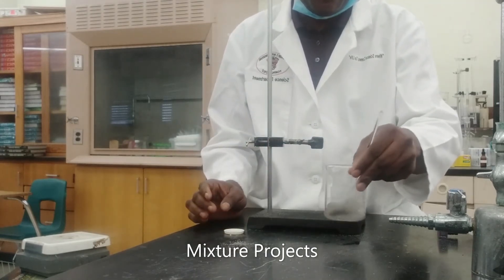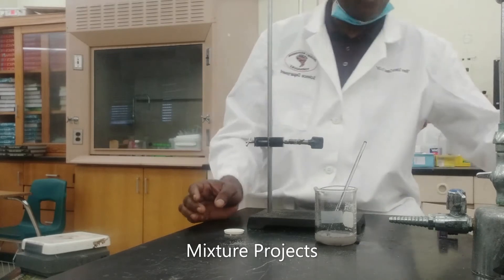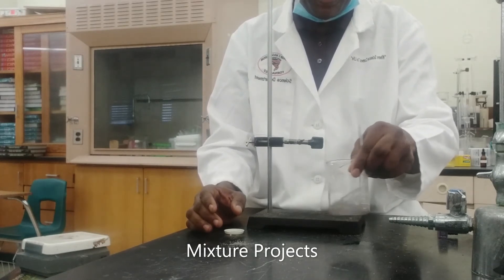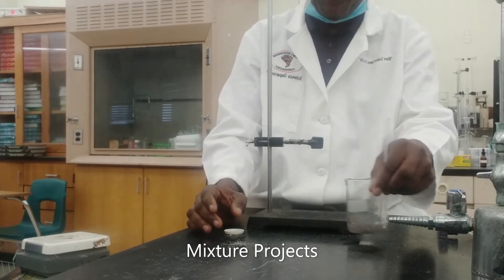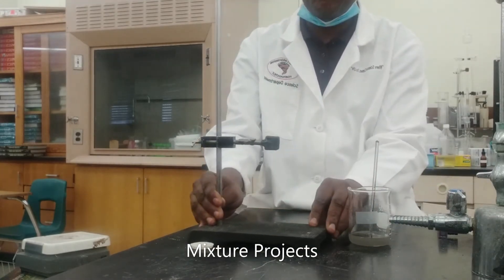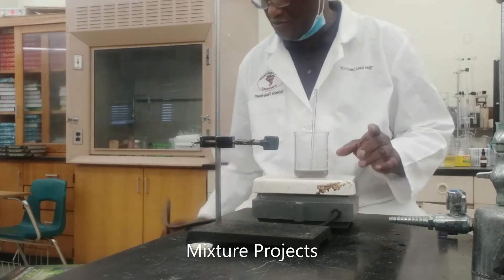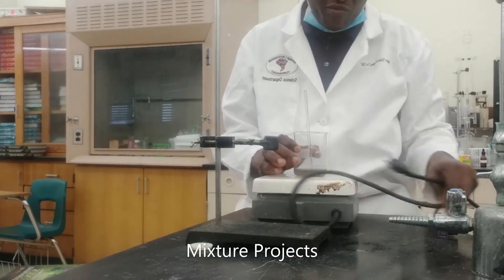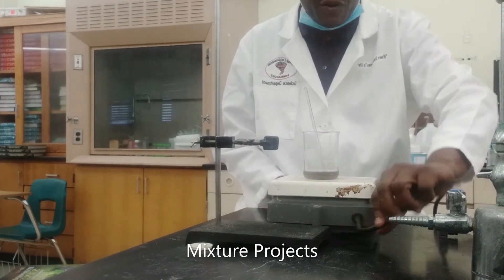Right now I'm adding water and we're going to give it a mix. I'm going to add some more water. Now we know that if you want more of a substance to readily dissolve, you can increase the temperature of the system. So I'm going to go ahead and heat up the mixture of water, salt, and sand — just warm it slightly so that I get all the salt to dissolve completely in the water.